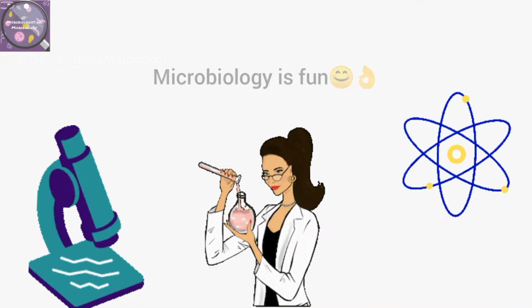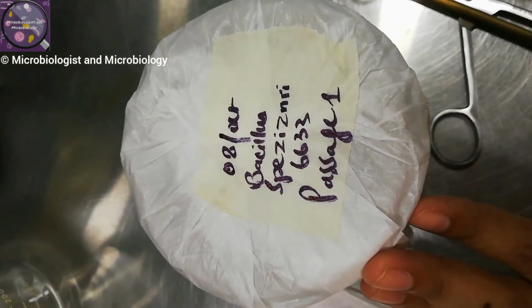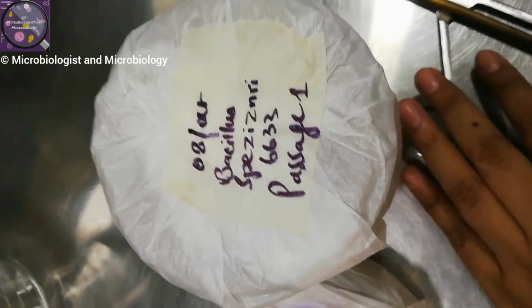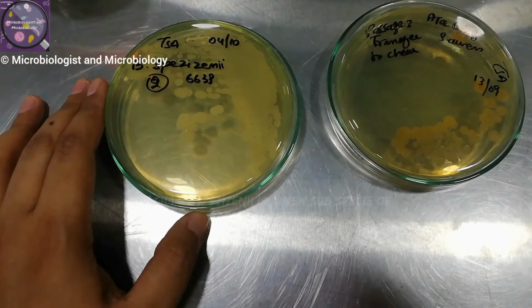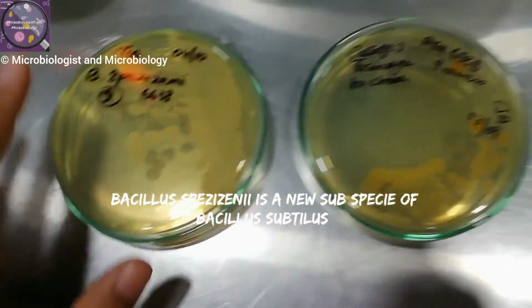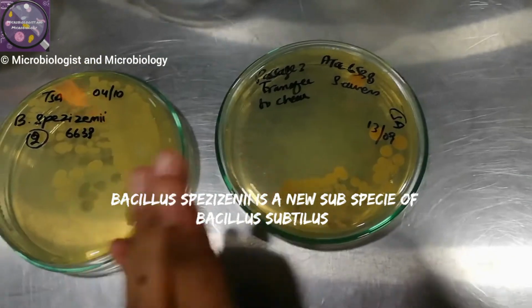Friends, I am a professional microbiologist, but like you all, I make mistakes, so apologies for that in advance. Here I am explaining my experience of how I do gram staining. So let's get started. These are two cultures I have selected to show gram staining. One is S. aureus, gram-positive cocci in clusters, and another one is Bacillus subtilis, gram-positive rods in chains. I will pick colonies from these plates to perform gram staining.